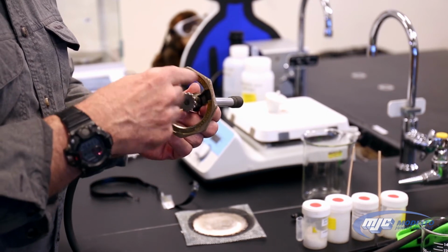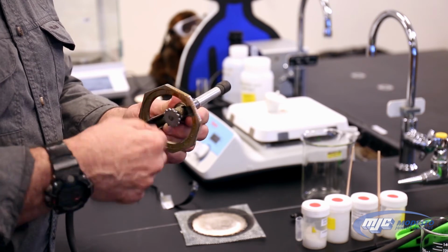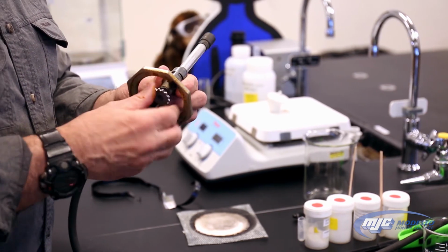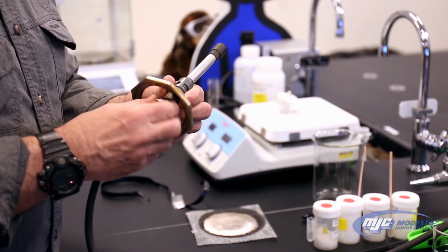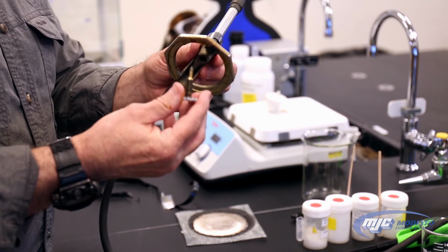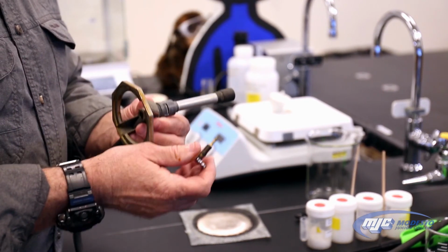The more this is turned in, the less fuel gets to the flame. The more it's backed out, the more fuel gets to the flame. Now, the only thing you have to watch out for, guys, is if you back this out really far, and you really have to back it out a lot to do that, and this is lit, what happens is this comes out, and now flames are shooting out the bottom of this Bunsen burner right at your hand.